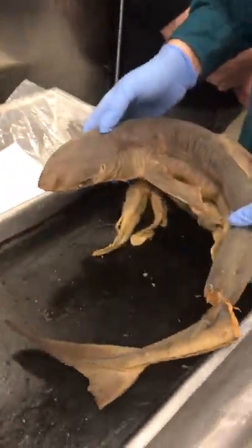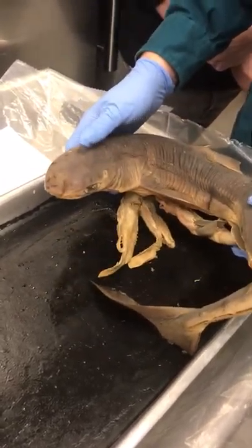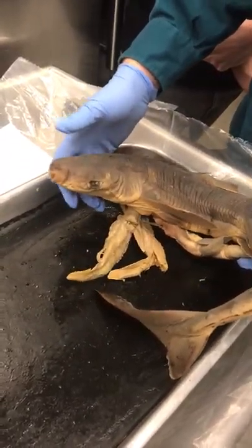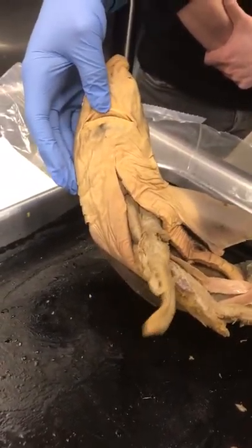Dogfish — but he's a shark, not a fish. Basically, these are bottom feeders. Sharks that are bottom feeders have their mouth on the bottom of them, so he has this little jaw right here. He's super happy.